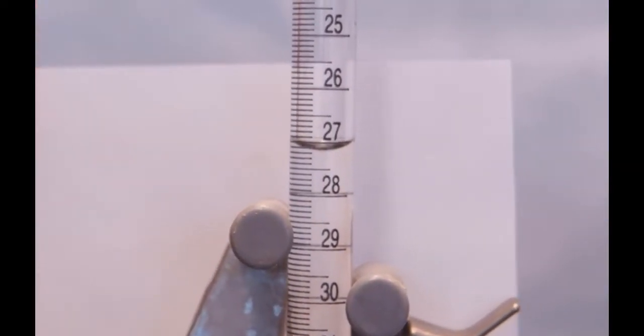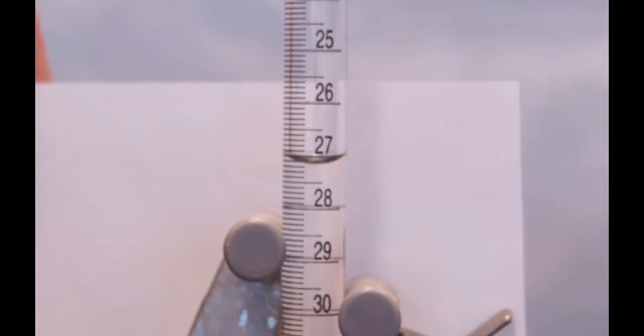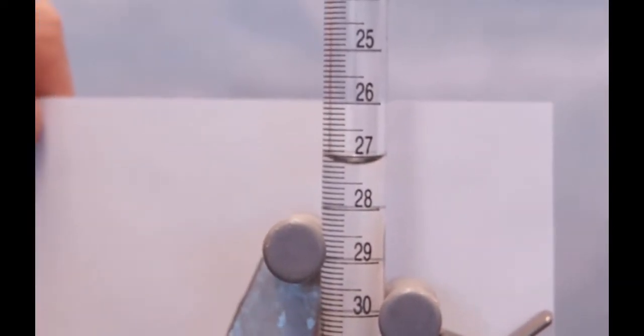So for our final volume reading, at our end point, we've got 27.26 milliliters of sodium hydroxide delivered.